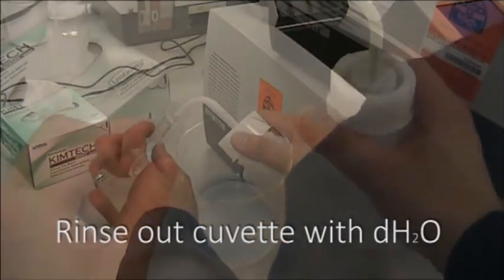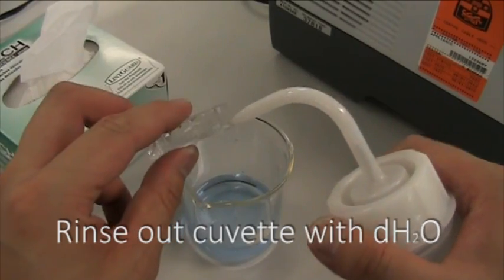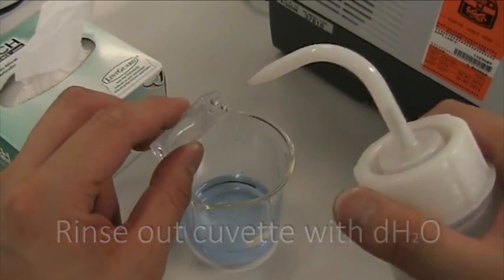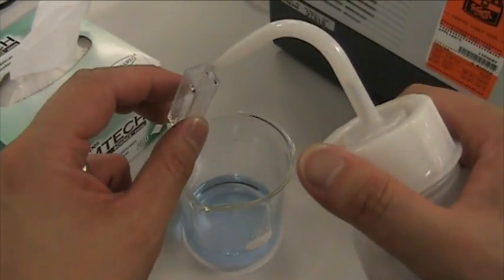After each use, the cuvette needs to be rinsed at least three times with deionized water. Ensure you rinse around the entire inside surface of the cuvette.